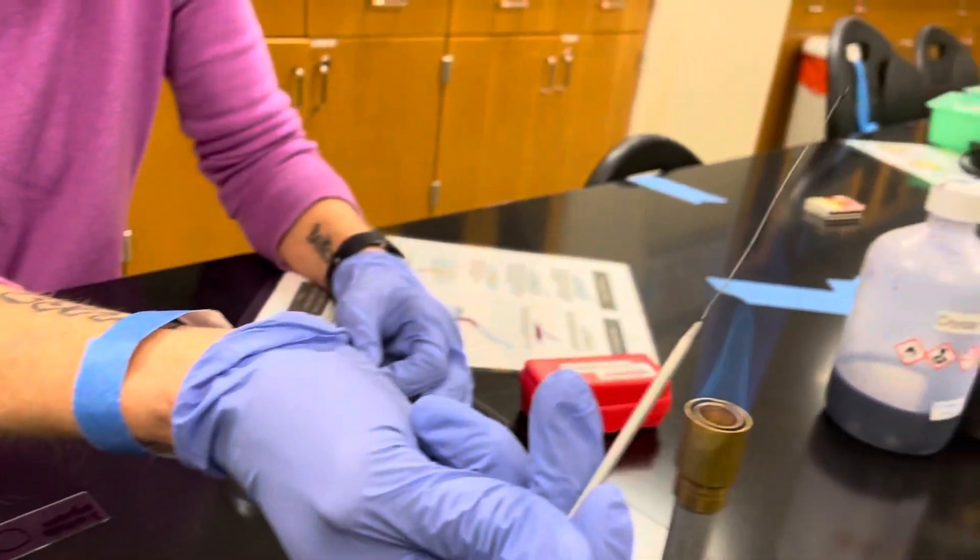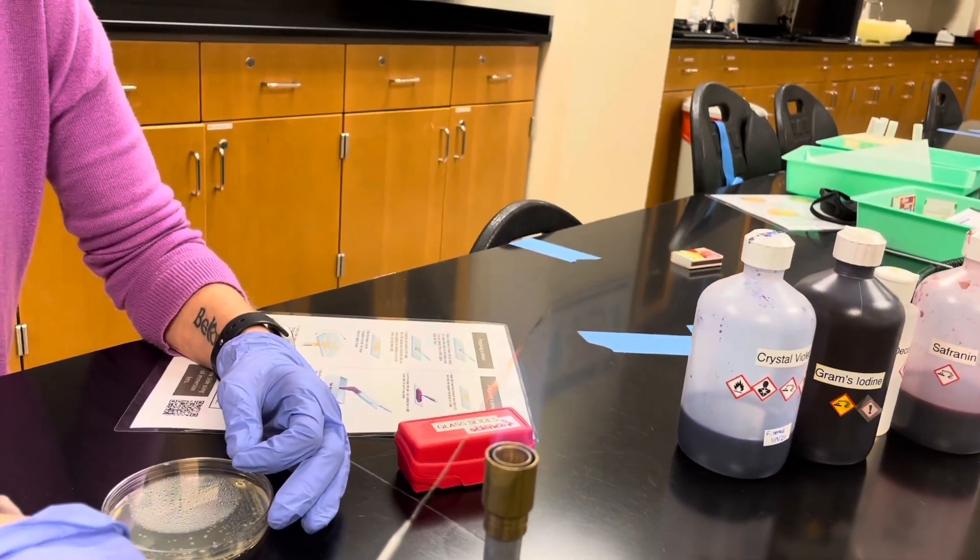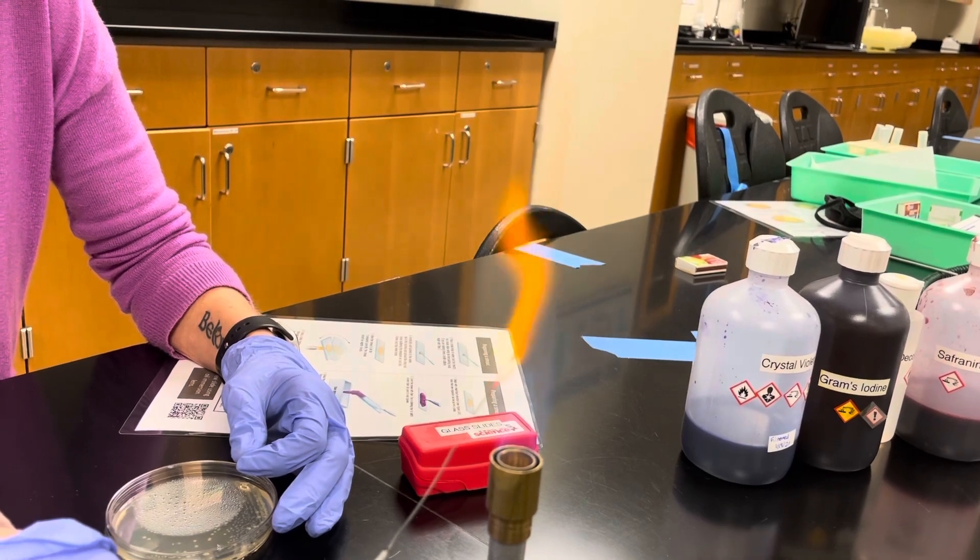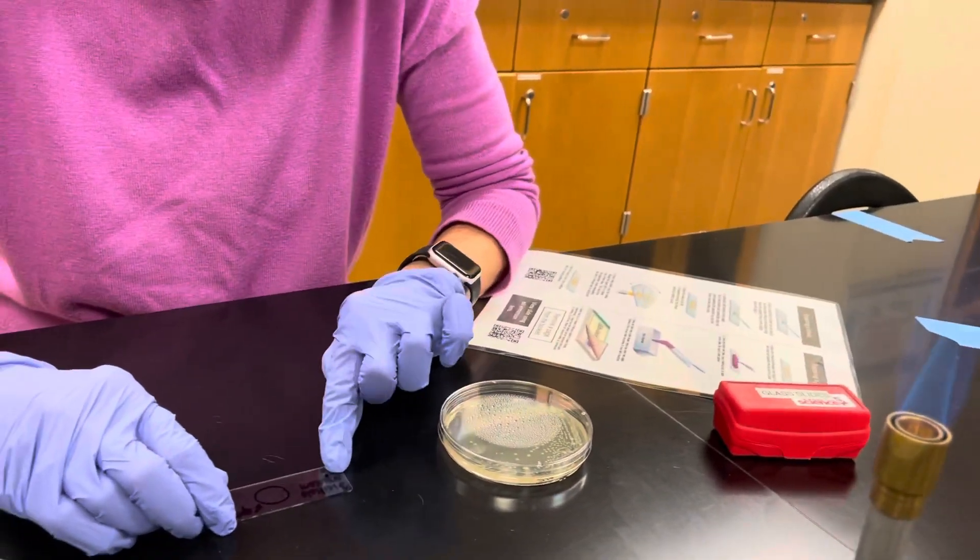Then you need to re-sterilize your loop from the base to the tip. And remember, you need to let your slide air dry.